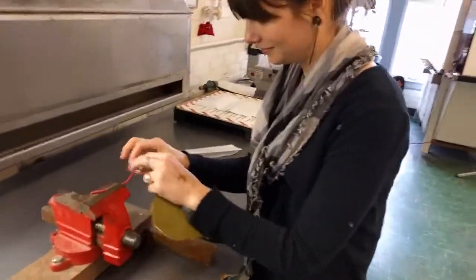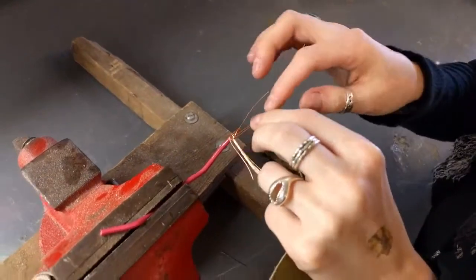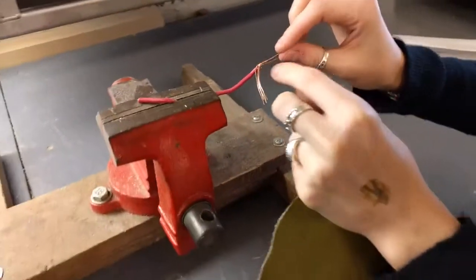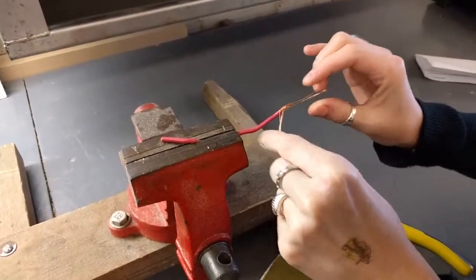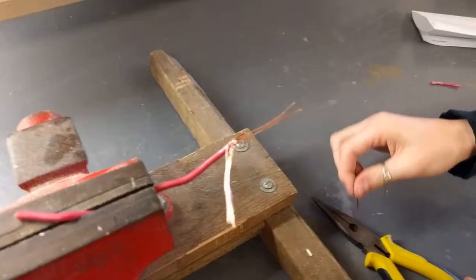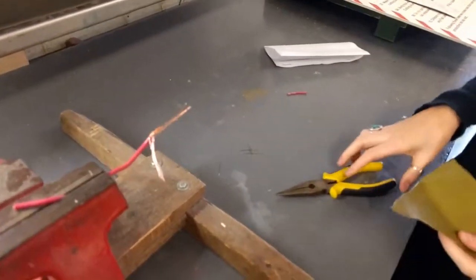Max is adjusting our instrument. So we have some copper wire, and we found a test online that if you heat up the copper wire and melt plastic to it and then burn it again, you can find out if there is chlorine bonded to the plastic.